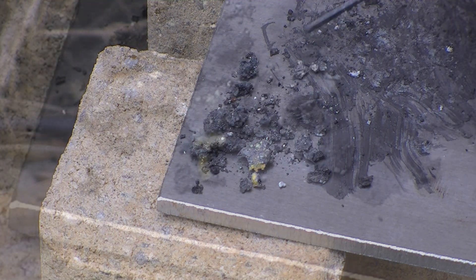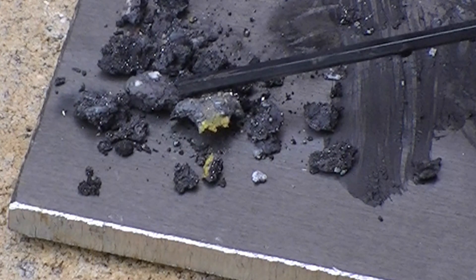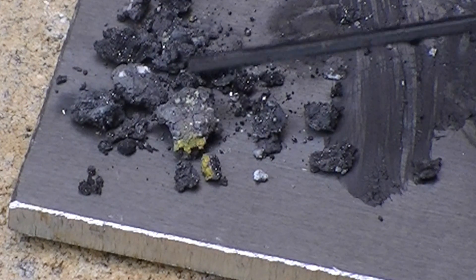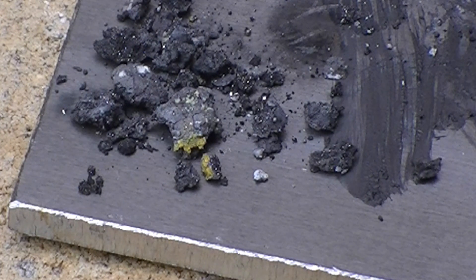On looking at the product that was formed, it doesn't look like we've been that successful. However, there are a few shiny particles indicating that we may have formed some metallic bismuth.